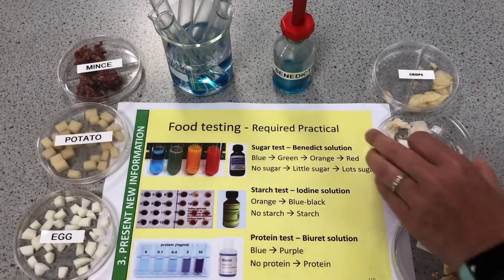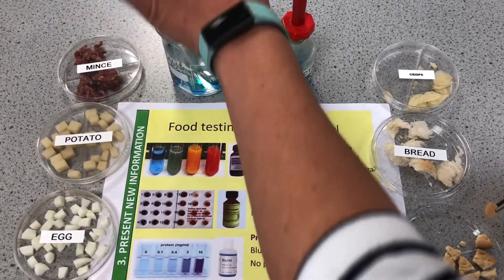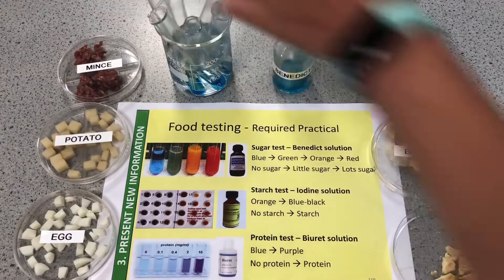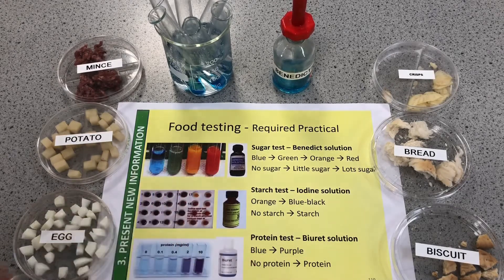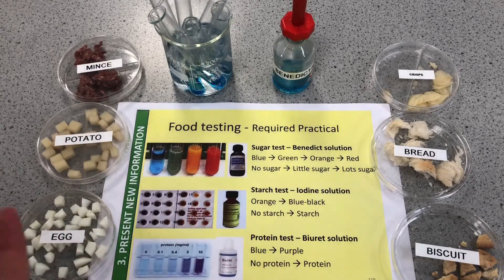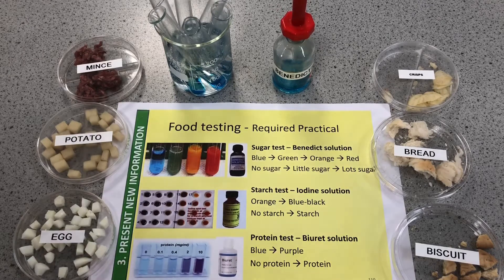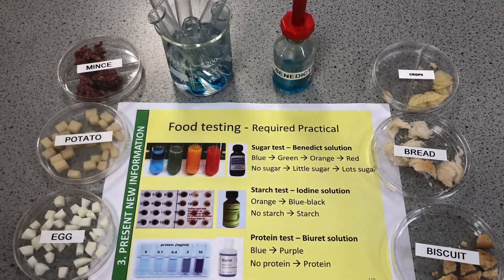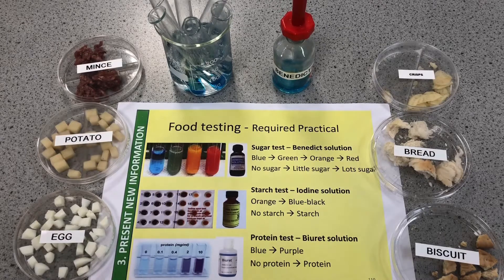If you imagine comparing some sweet items, if you use the same volume of Benedict's solution each time and the same mass of each food, you could actually use this to compare the amount of sugar — because if one went redder, you know there is more sugar in it than one that stayed green. That would make it a fairer comparison, and you could rank them. This is the kind of thing that could come up as an exam question.